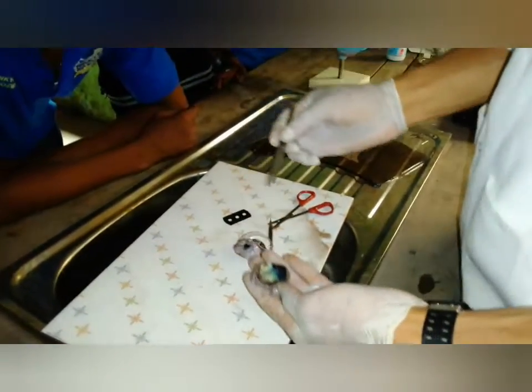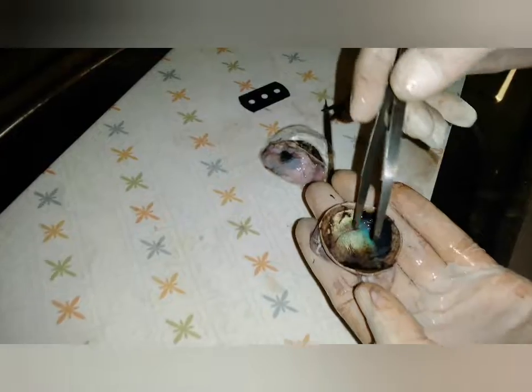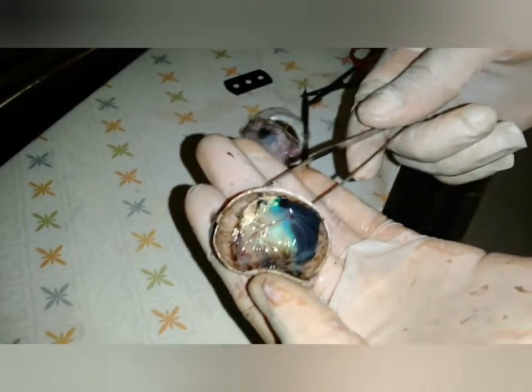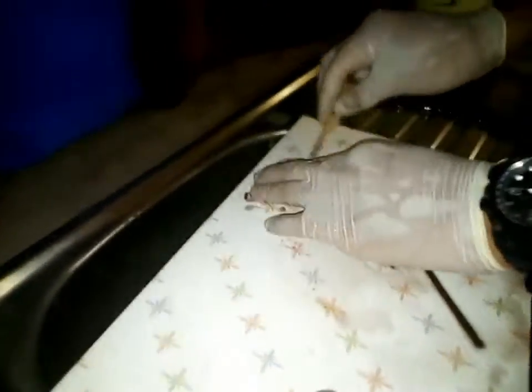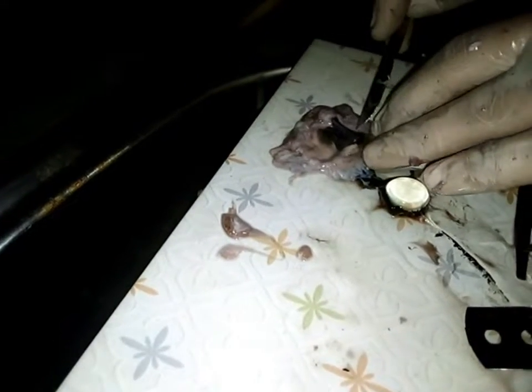Now listen, if you look at this now, you see some of the arteries, or let's say blood that came out of it. And this part, as you can see, is where the optic nerve is located. I told you what the optic nerve is. Now listen. Now here we have what? We have the cornea, like I told you. Are you getting me? Now you can see the iris.